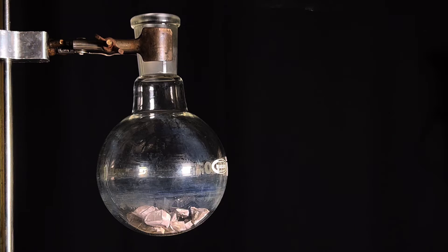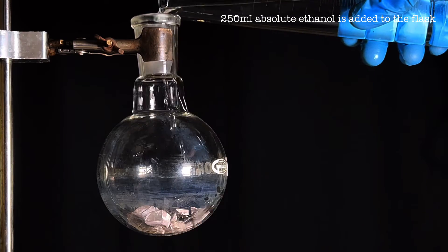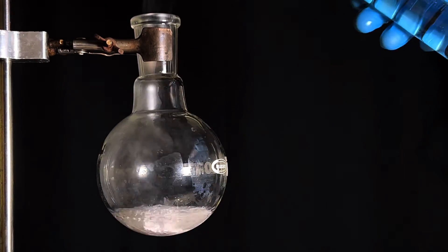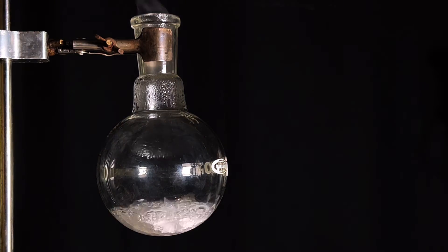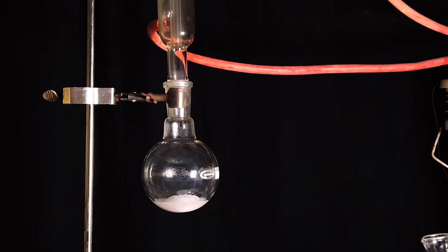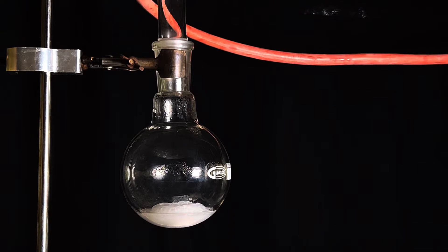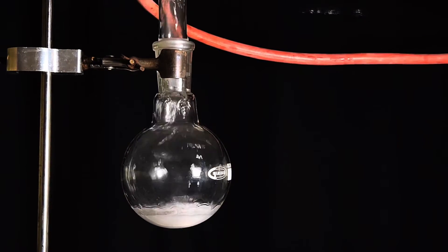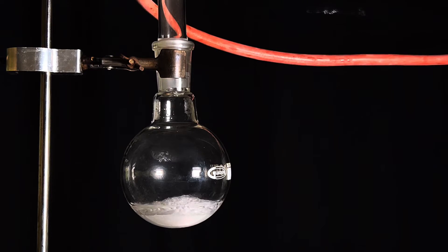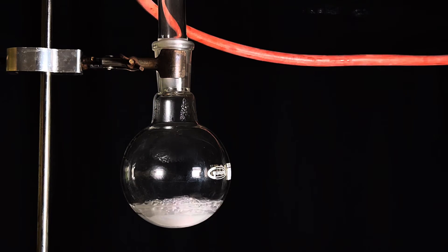Once transferred, 250 milliliters of absolute ethanol was added to the flask. I proceeded to add all the ethanol at once as per the literature, but the exothermic reaction became unduly vigorous. So I quickly set up a condenser on top and started adding ethanol from the top in small portions. If the reaction gets out of control, it can be slowed down by immersing the flask in an ice bath for a few seconds. I have an ice bath at hand's distance just in case.